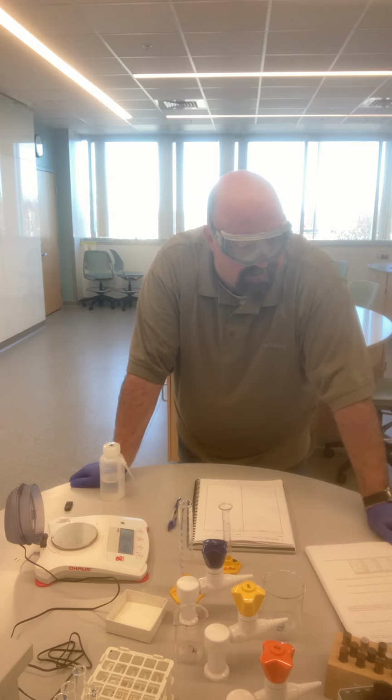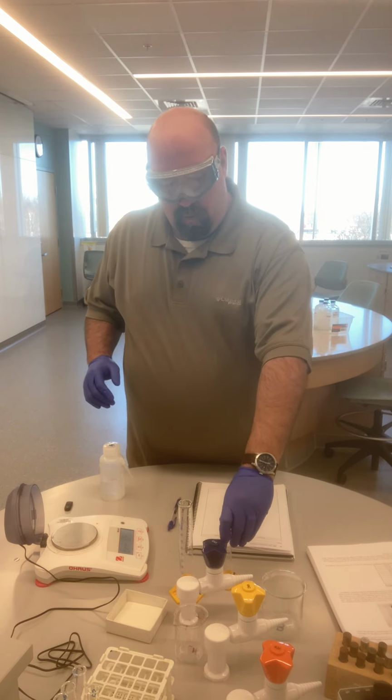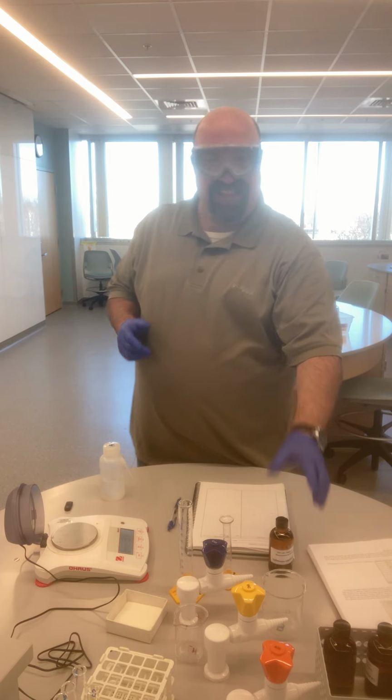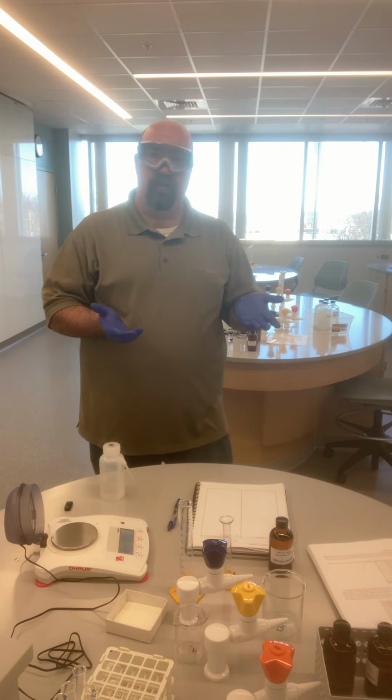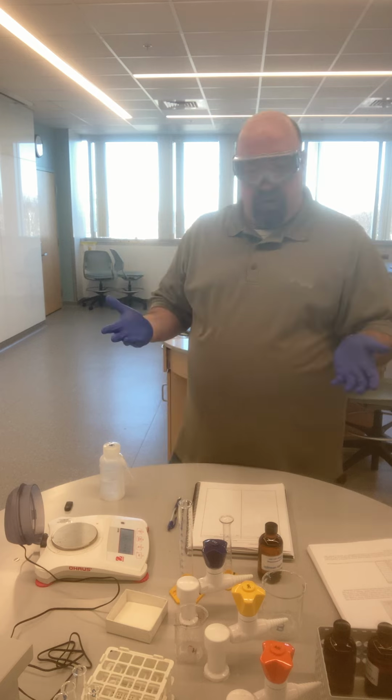And so we have a couple things that we need to think about and a couple challenges that we need to try to overcome. We're first going to look at finding the data that we need for our liquids. So here we have unknown liquid 1. In order to calculate density, density is the mass divided by volume. We typically use units of grams per milliliter. And so I need to be able to take a sample of this unknown liquid, and I need to be able to find the mass of that and the volume of that liquid. And so we need to think about how to do that.